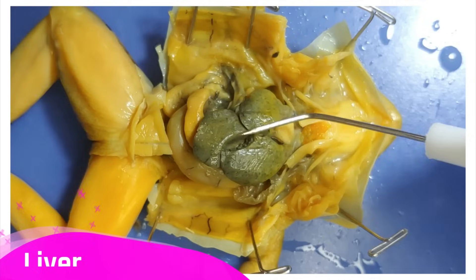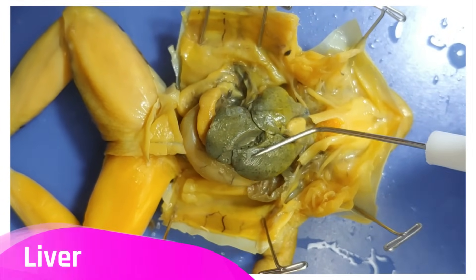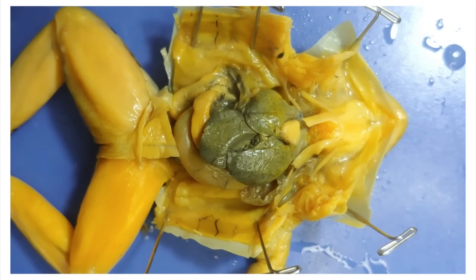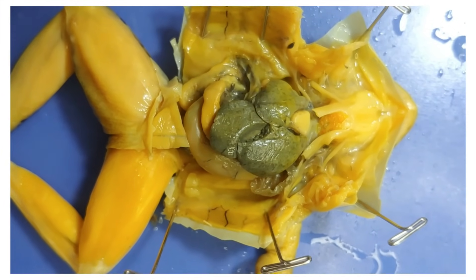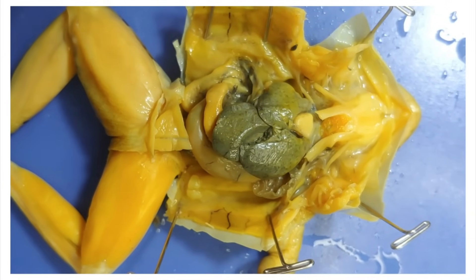The first thing you see here is the liver. The liver has three lobes and it's the largest organ in the frog's body. The liver is the ultimate multi-tasker — it produces bile, stores and releases glucose, detoxifies blood, and more.